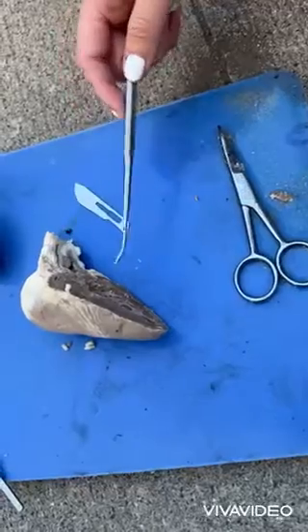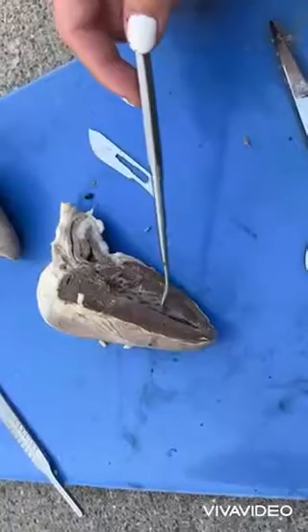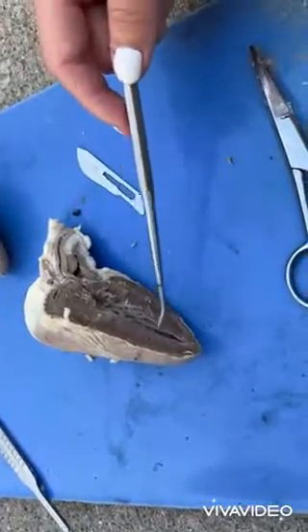Next, we have the tricuspid valve. It's one of the four valves in the heart that control blood flow.